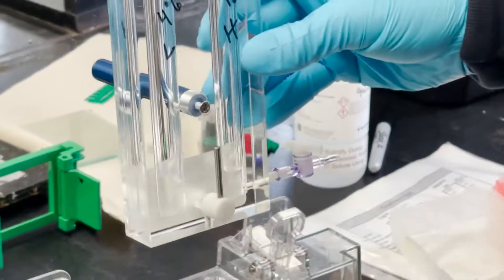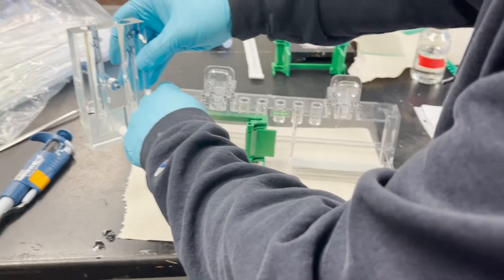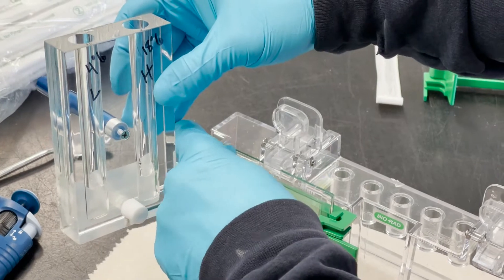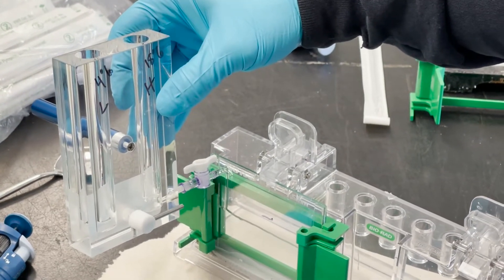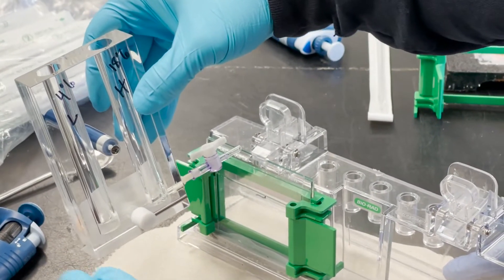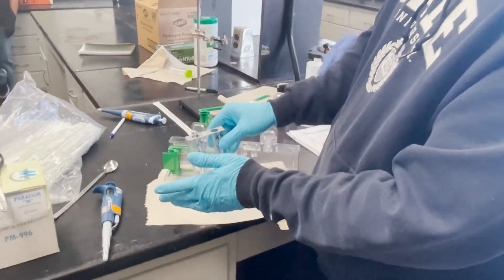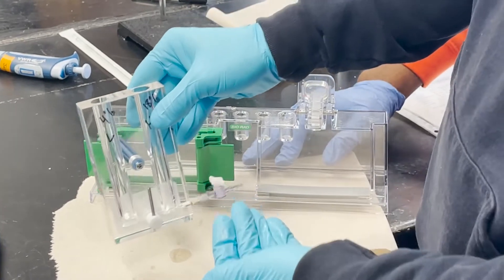They should now be polymerizing. The trick is to open this and get it pouring into the plate as it mixes. It's pouring really fast. That might've actually been pretty good. If you use the pump, it slows it down and you have more time to mix. That was really fast, but it doesn't mean it didn't work — things can mix fast too.